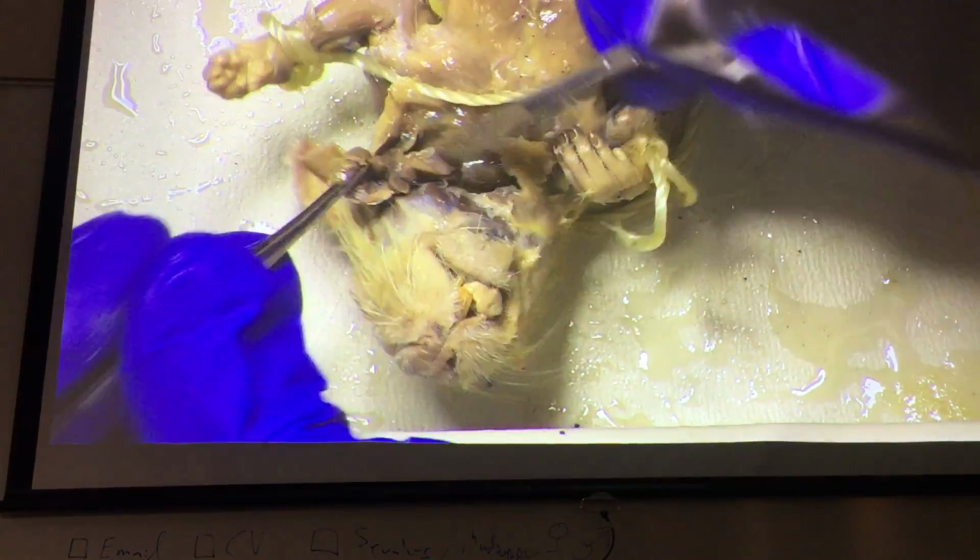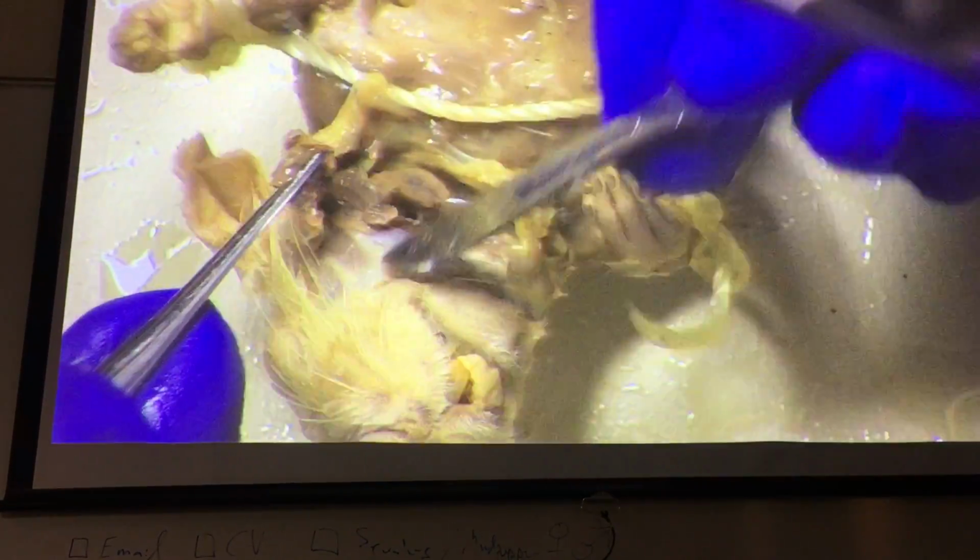But you notice how it breaks up like that. That's going to be very common for large glands. We're going to see that when we get into the visceral later. Large glands will be broken up into lobes and lobules, which gives that kind of granular look to it, which is why they describe it as looking a little like corned beef.